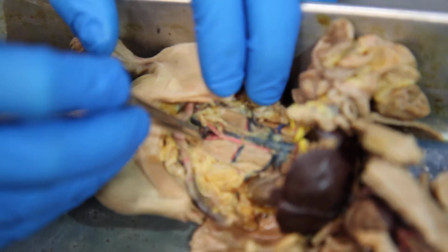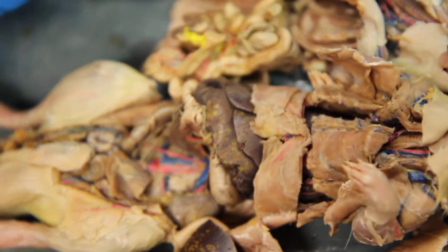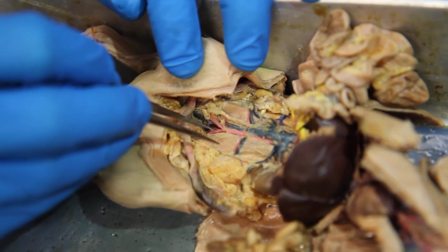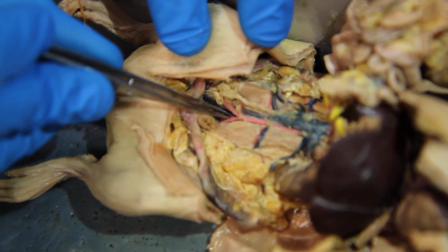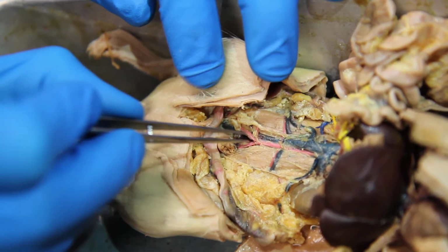The descending aorta splits in two. Basically these arteries go to the legs, and they're called the common iliac. Remember, this was circumflex iliac. This is common iliac. And then usually behind the common iliac is the median sacral artery. It's this one right here. Right there. You see it? Every once in a while, it connects right in the middle, so it looks like it's coming off the front, but usually it's supposed to be coming off the back, like the back of the prong, like that.